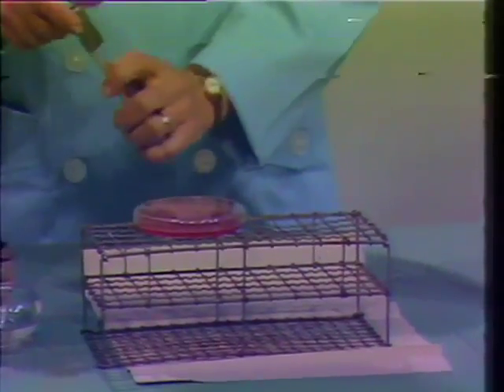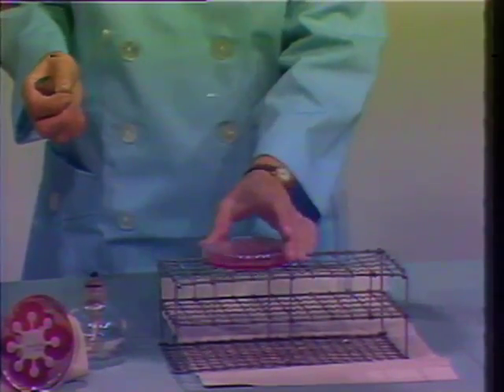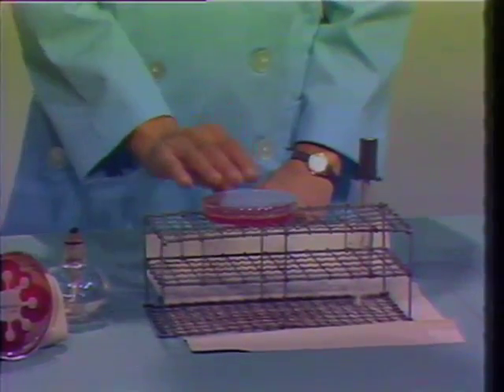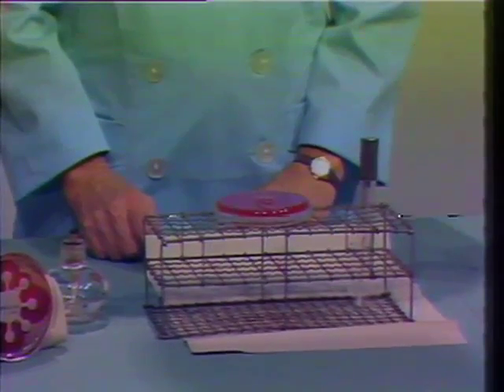Next, our technician will demonstrate the processing of the swab that was submitted for culturing. After flaming the tube, she removes the swab and smears the surface of a blood agar plate. In order to distribute the material more evenly, she will take a wire loop which has been previously sterilized and will further distribute the material around the surface of the plate. The plate is then incubated for a period of 24 to 48 hours. On one of these plates, if multiple plates are done, antibiotic discs can be placed and the zone of inhibition can be determined after 24 hours.